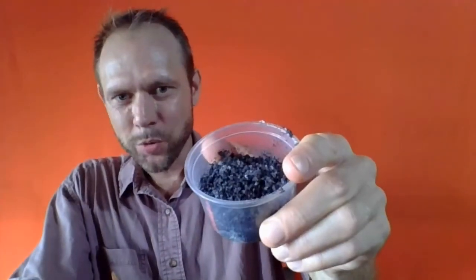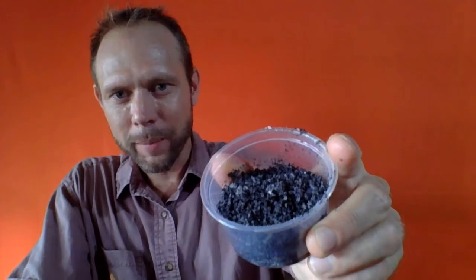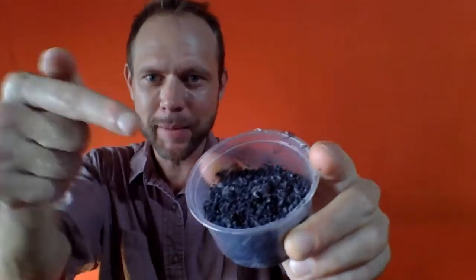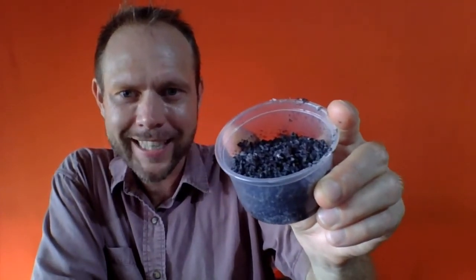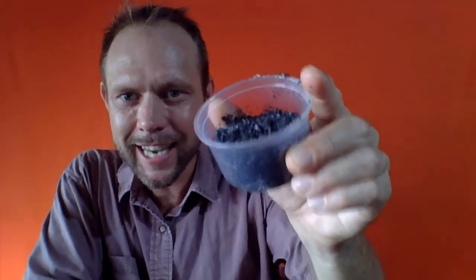So the idea is that this is normally how we find things in nature. We don't normally find things 100% pure in nature, rather raw materials, natural resources. They tend to be a mix of a lot of chemicals, kind of like this. There's valuable stuff in there. Salt we could put in our food, black sand that could be used for a bunch of different things. And yet we need to purify these substances. We need to get them apart.